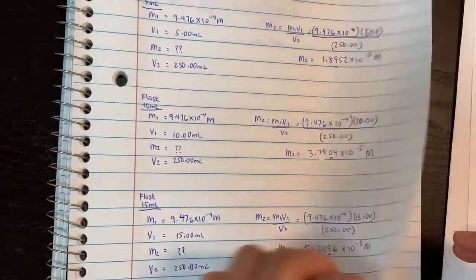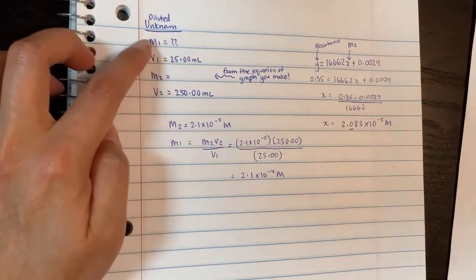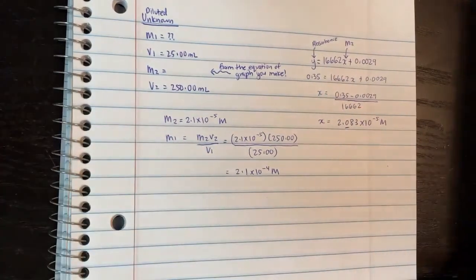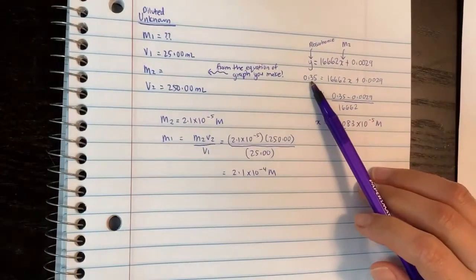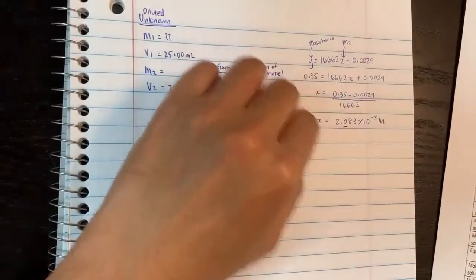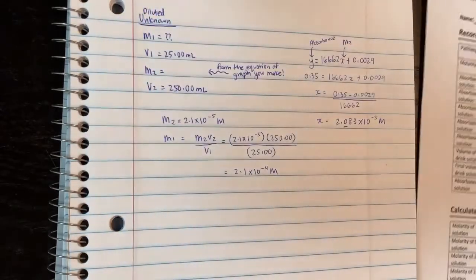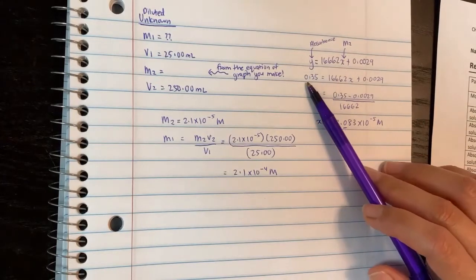The next page deals with the unknown Gatorade solution. In my case, it was diluted 25 mL into 250 mL, and I got an absorbance of 0.35. So 0.35 goes into y of your graph equation. Whatever the absorbance of your diluted Gatorade unknown is, that value goes into the y variable of your equation. Everyone's equation will be different — put your own absorbance in and solve for x, which will be M2.